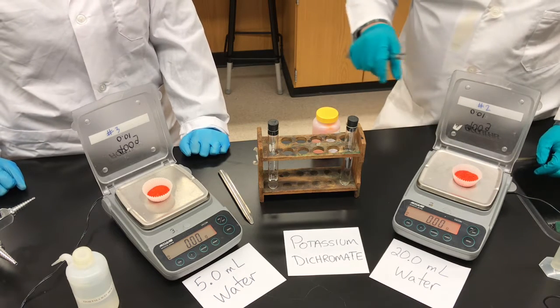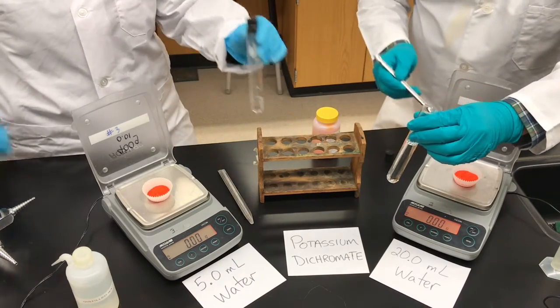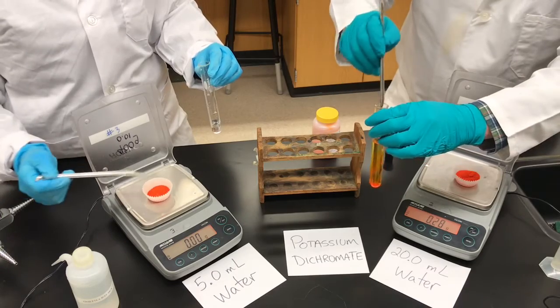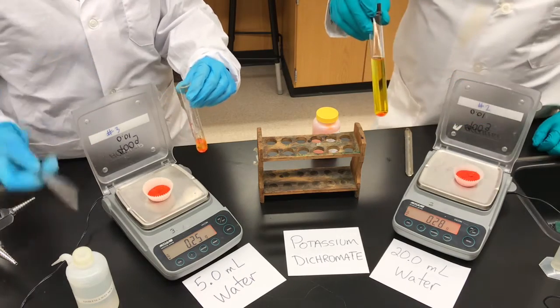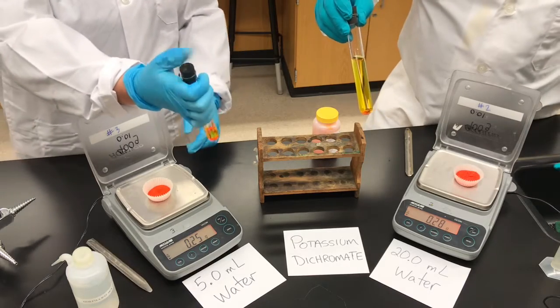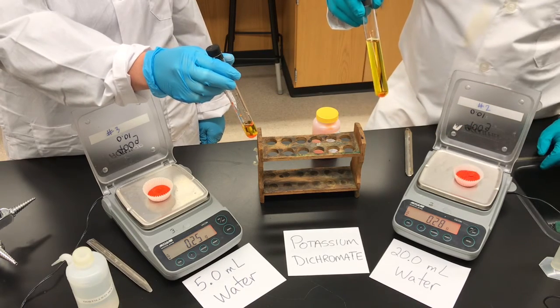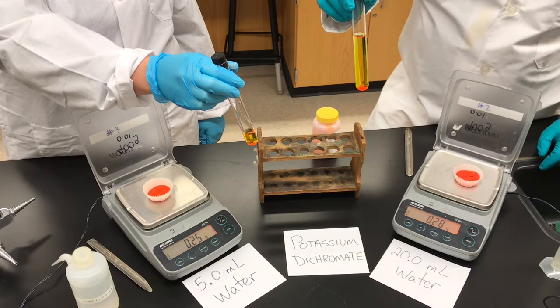What Mrs. Watts and I are going to do is take our test tubes — I'm taking my 20 milliliters of water — and reach in to take a pinch of the salt and add it to the test tube, then stopper it. We've both done this and created a mixture. We've got the solvent, the water, and the solute — most of it is sitting at the bottom, but some has dissolved. It's starting to get a little yellow-orange color. Right now it's a heterogeneous mixture; it's not yet a solution.